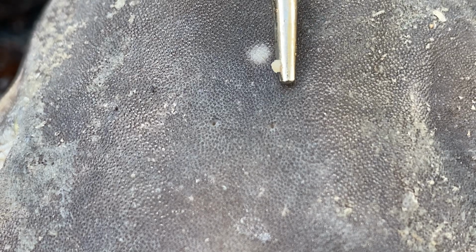It's not really a good idea in the ocean if you're trying to be streamlined. It's not a good idea to have earlobes. It would definitely slow you down. So these are the openings to the inner ear. You've probably guessed that hearing is not exactly a strong sense for sharks, and you are correct. So yes, they can hear, but it's not nearly as good as what we can hear out there. So the endolymphatic pore is the opening to your inner ear.